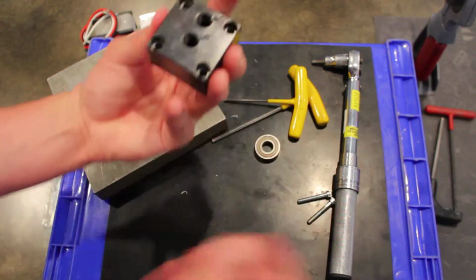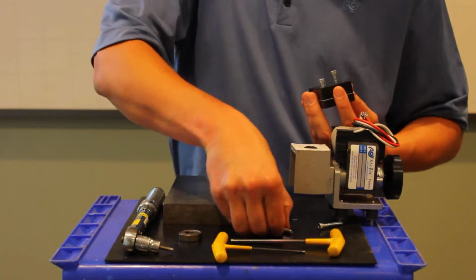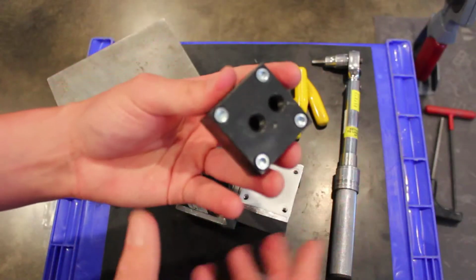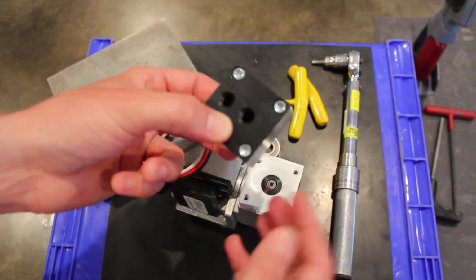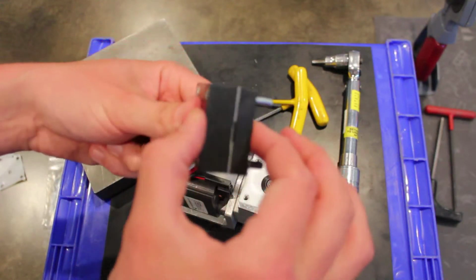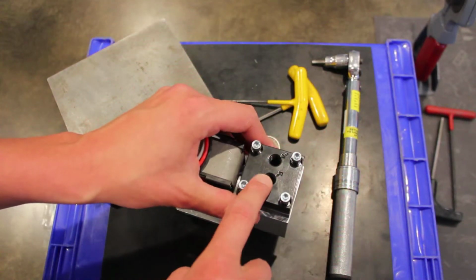Okay, and then keeping that upright, we'll take the 4 bolts with the washers already down there, and we'll just place them right on top in there. This head assembly can be moved as long as you've got the valve body together with it. It can be rotated in any position to make your plumbing easier, but it's very important that you move both the head and the valve body. So I typically install it so that my inlet port is on the top, discharge port is on the bottom.